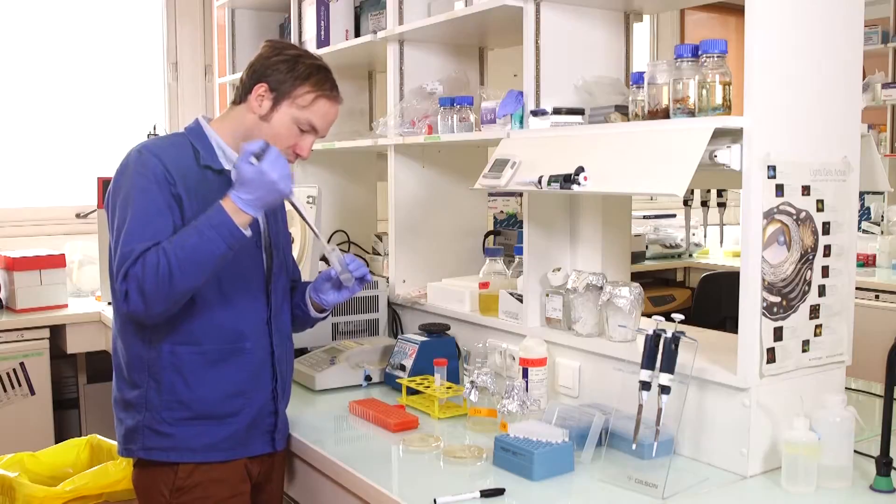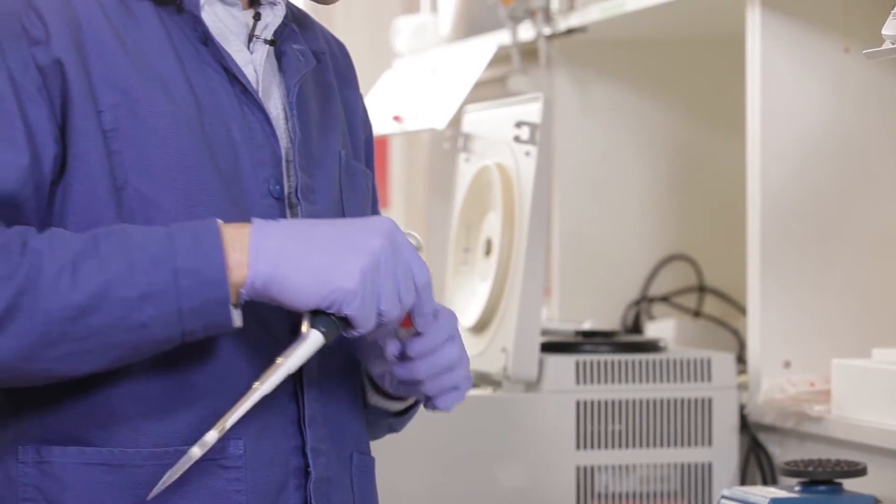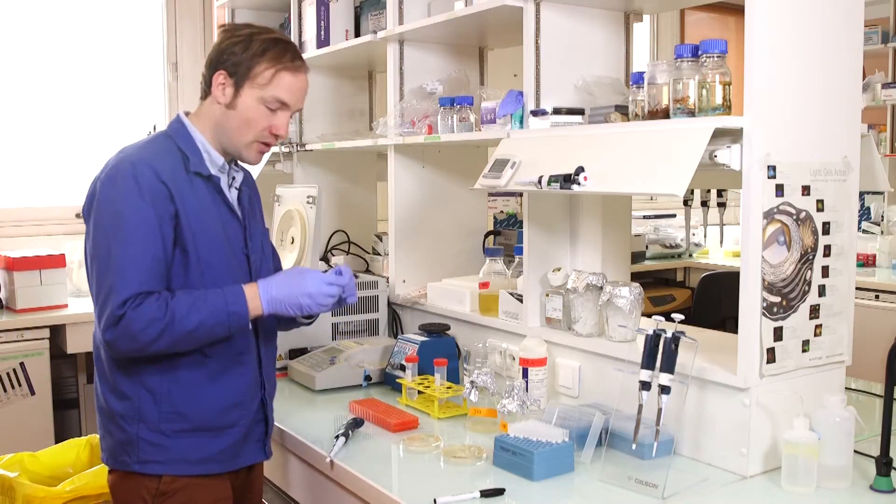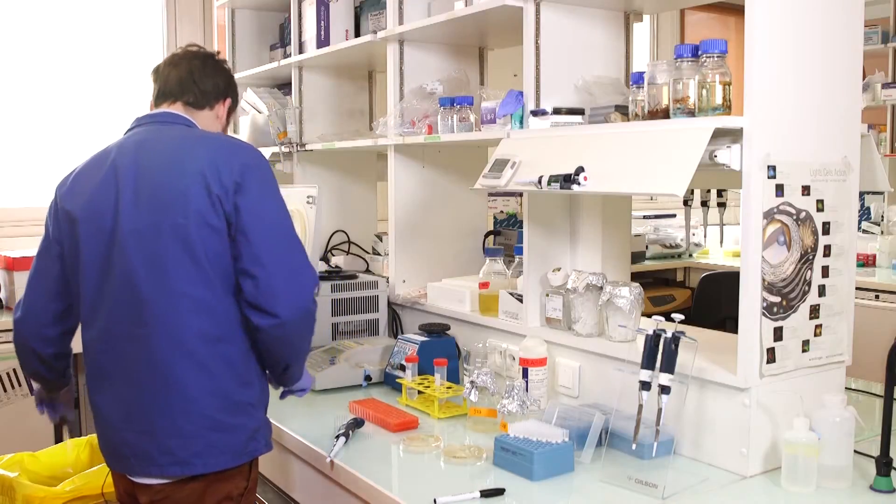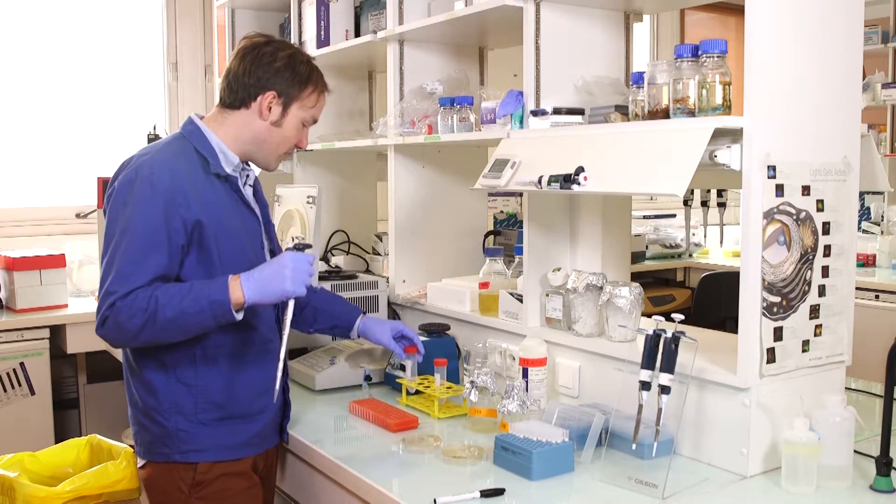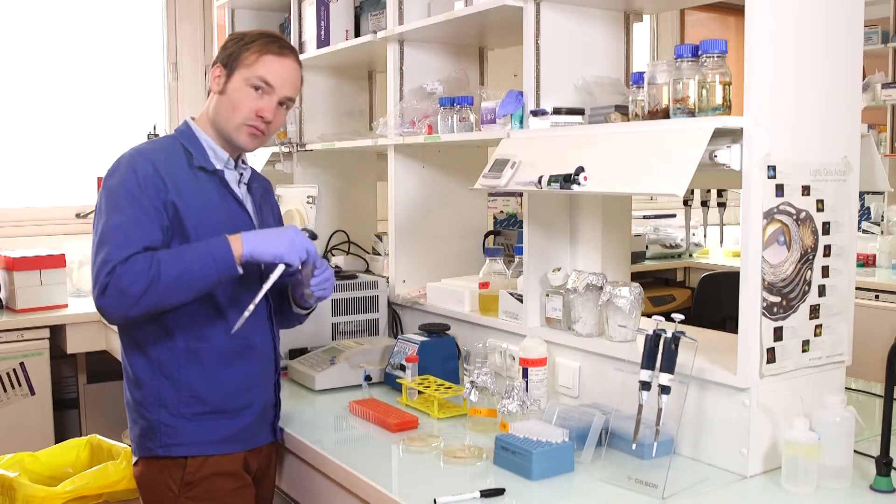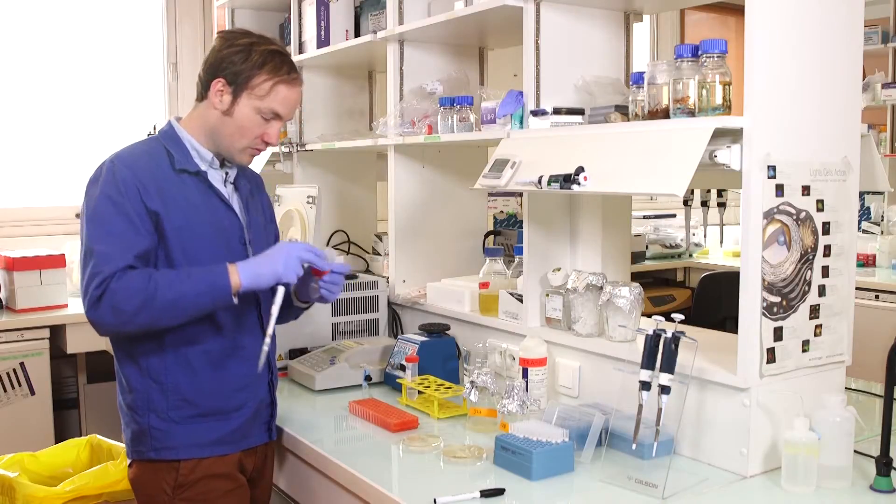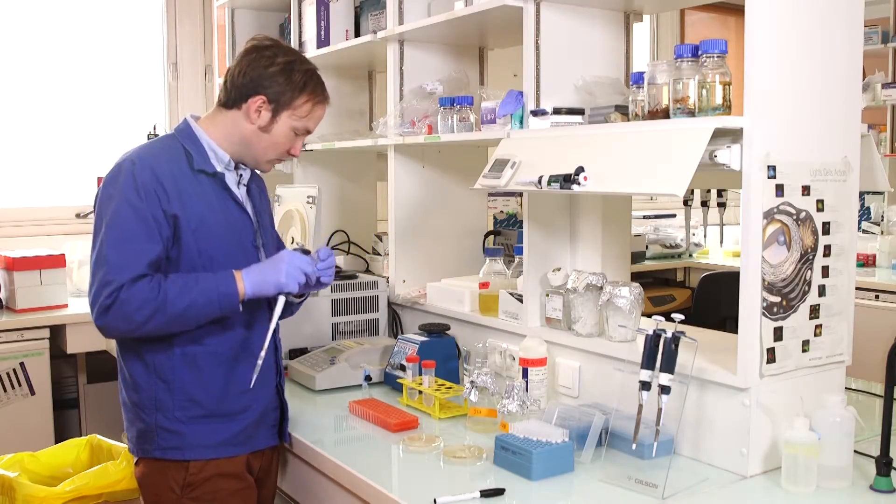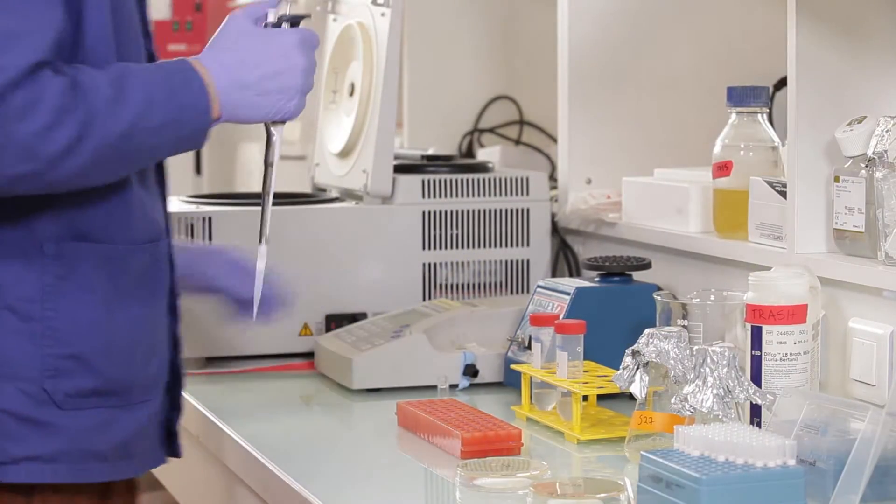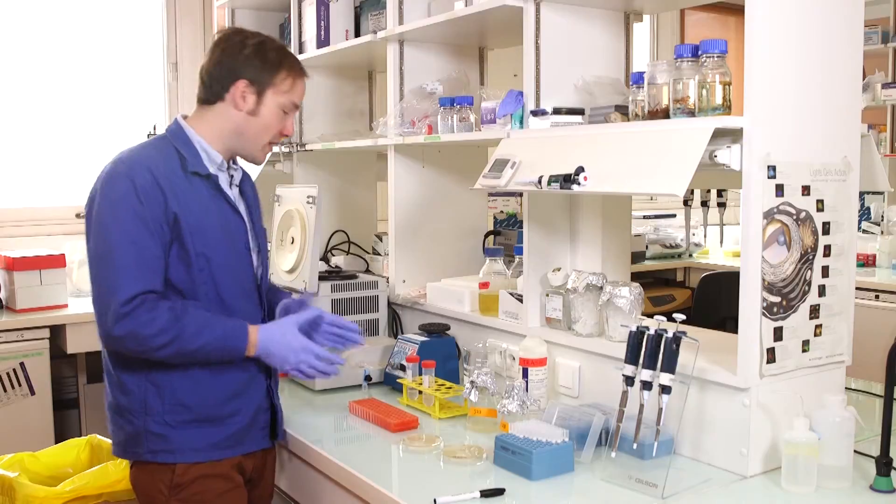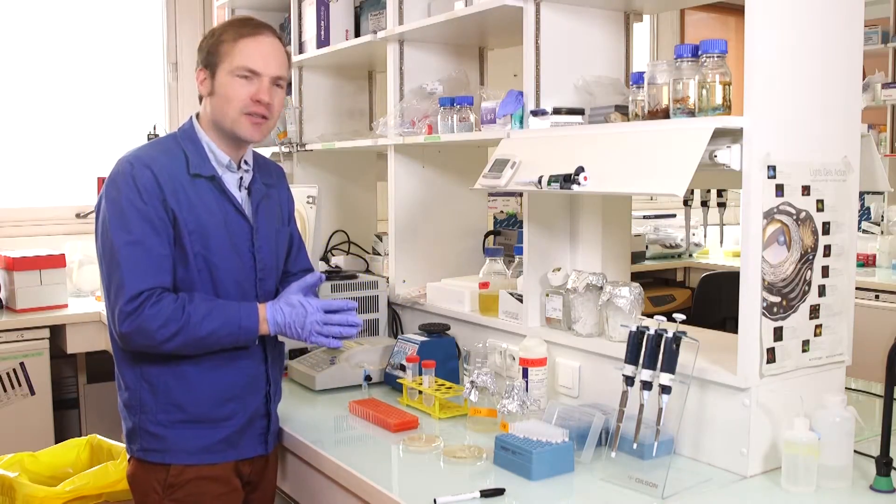A few hundred microliters of these cells. Load them into a cuvette. And I've already prepared the spectrophotometer. I've blanked it with a blank of just pure PBS. So I've got an OD of 0.37 for the first culture. And 0.38 for the second culture. And that makes sense. That's about where I expected them to be. Normally, of course, I would write them down. But you guys will remember, right?